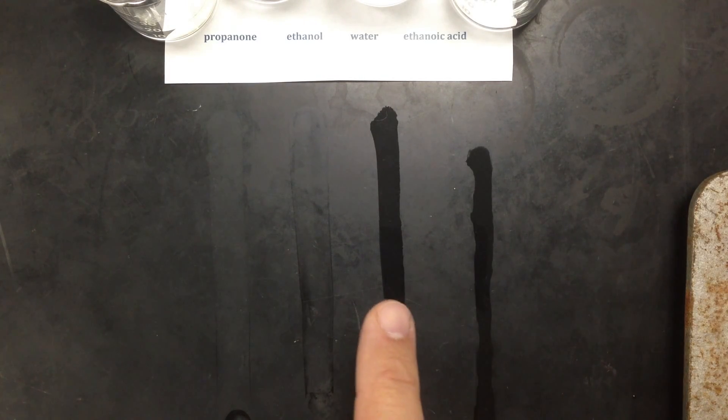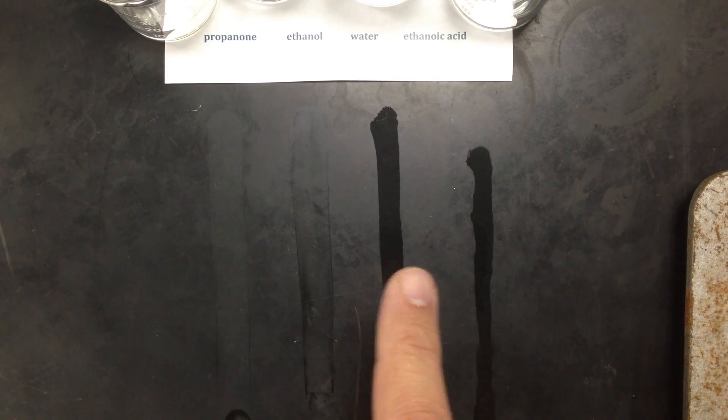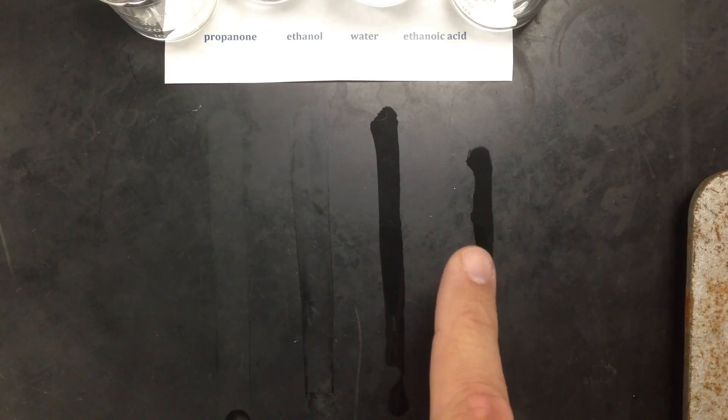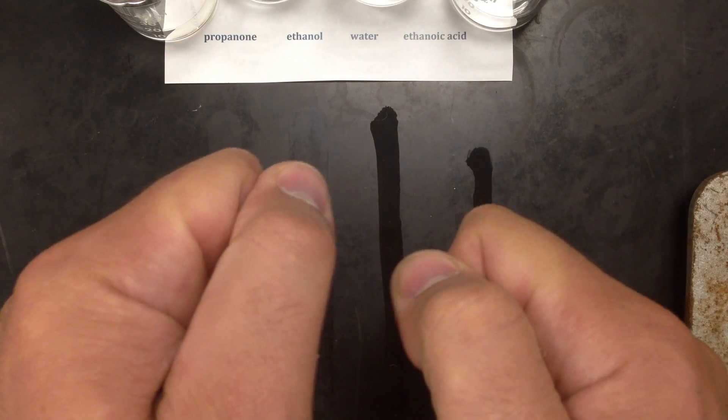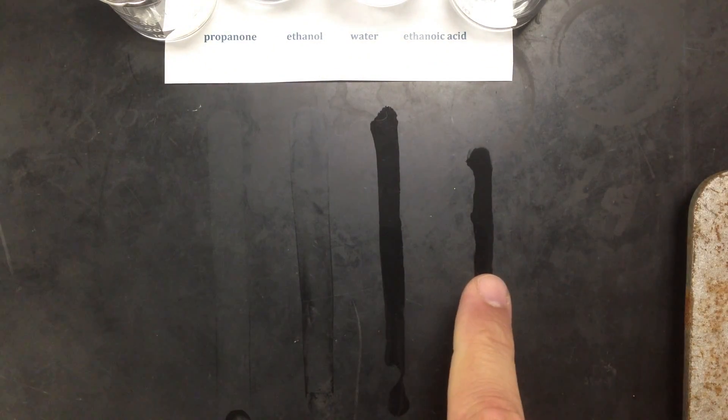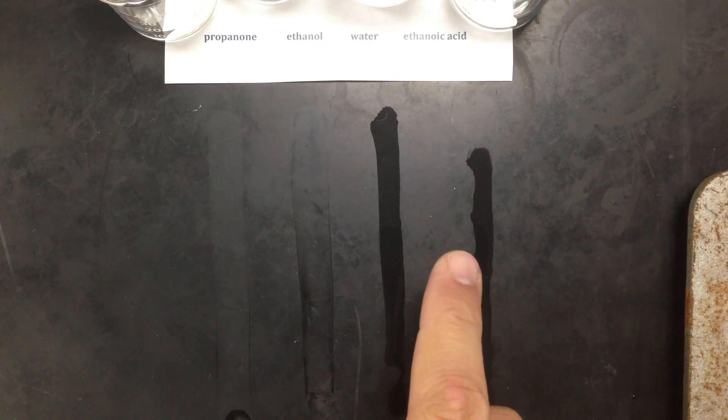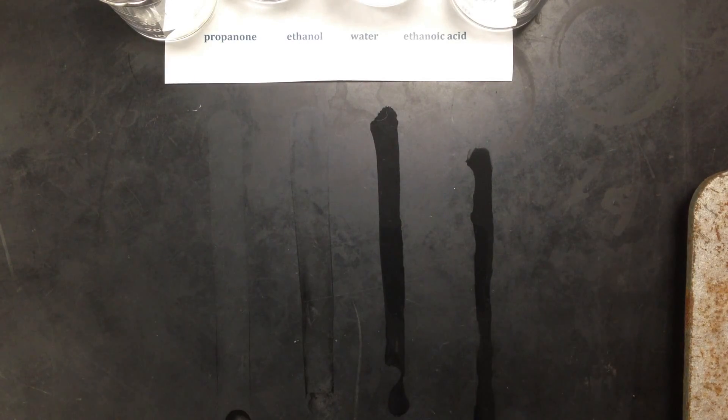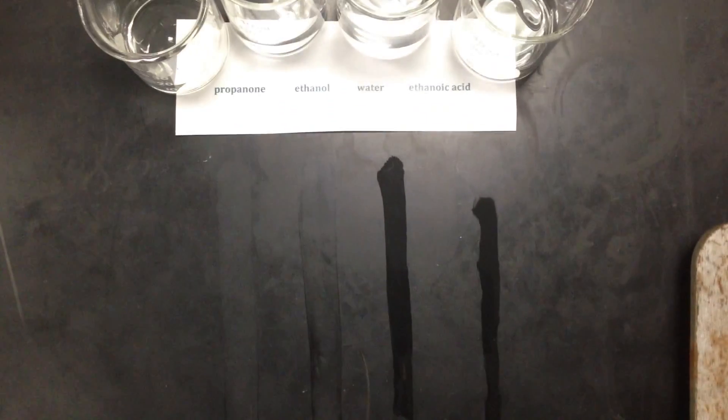I'm not going to wait another 10 minutes, but you can see why. The reasoning is because the ethanoic acid is beading up more, which means it's attracting each other more, which means it needs a lot more energy than the other three liquids to escape and completely evaporate.